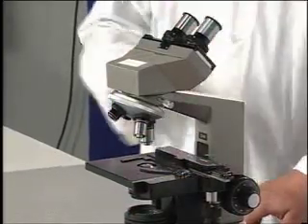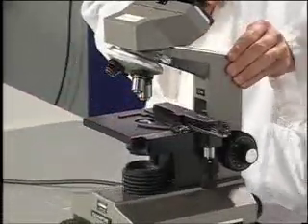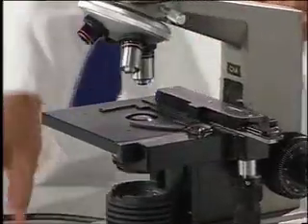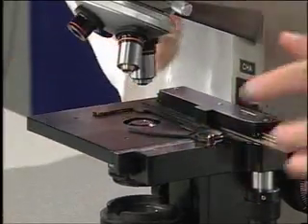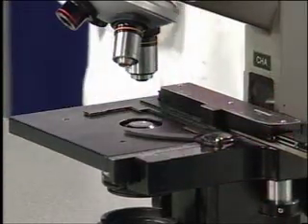40. Okay. You have to remember to multiply the 10 factor. Gotcha. Okay. Next structure to make note of would be the stage. Stage. And the stage is this great big black platform. That's a good name for it, eh? The stage. Yeah, the slides on the stage, a performance. Exactly. Okay. And we're going to see organisms performing for us briefly. In order to hold the specimen or slide in place, there's also a stage clip, and it is spring-loaded. The stage clip, okay. Yeah, and it holds the slide nicely in place.